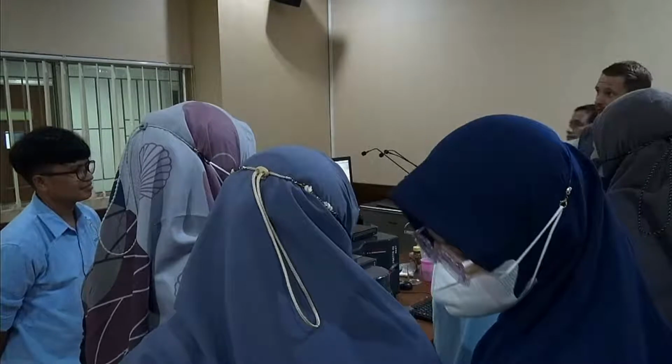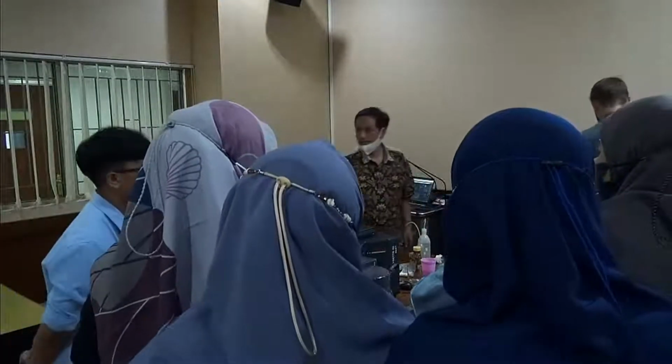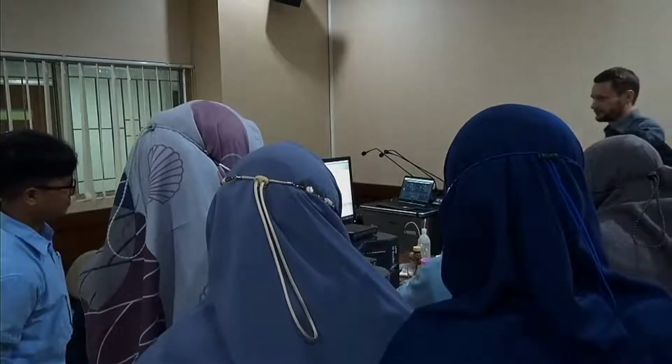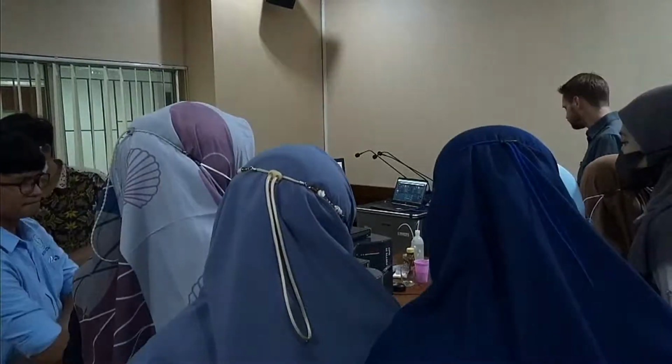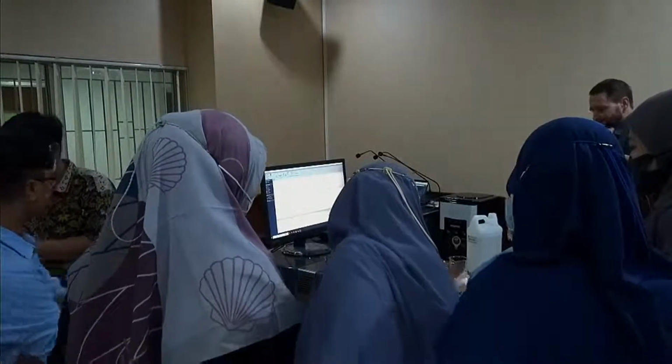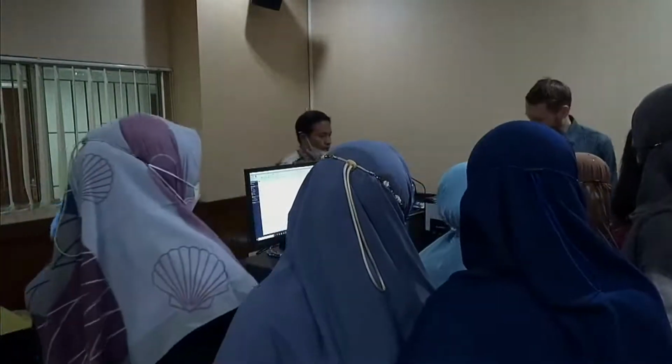So, 55 is what we look at. My sample. You have already sampled. I have a couple of samples, yeah.